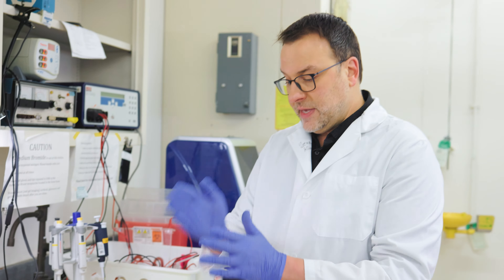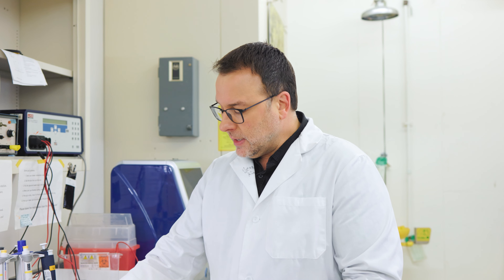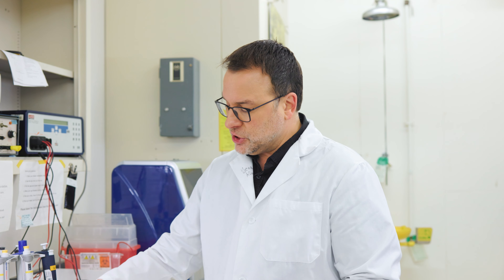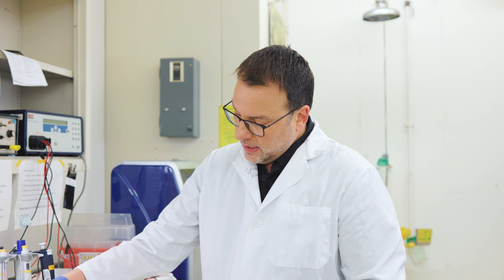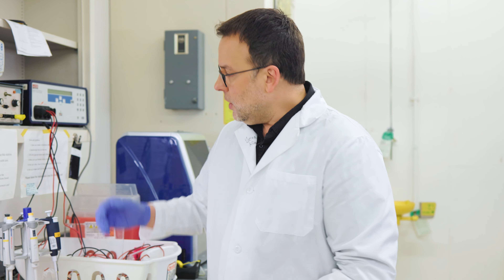What I'm doing now is that this contains the original DNA that I put in there and then the amplified chunks — hopefully, if everything worked.